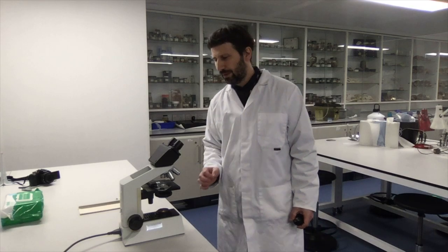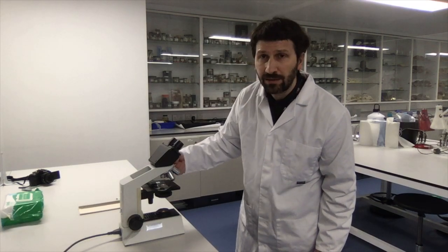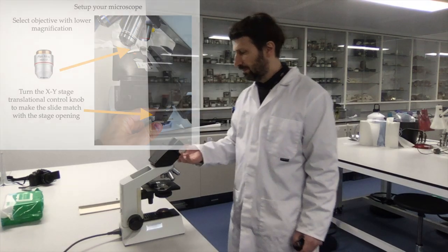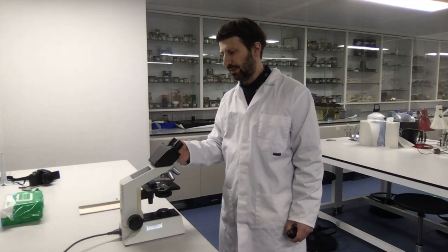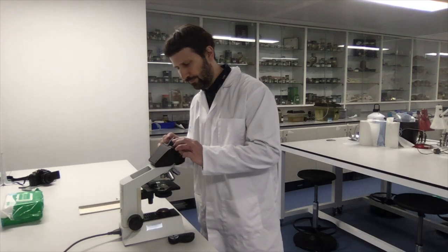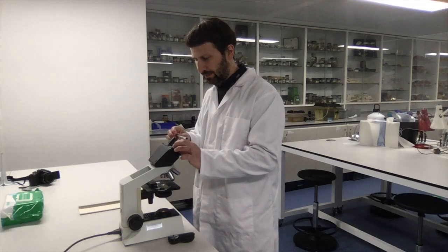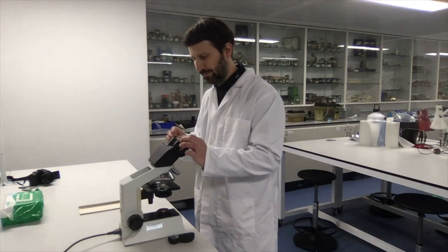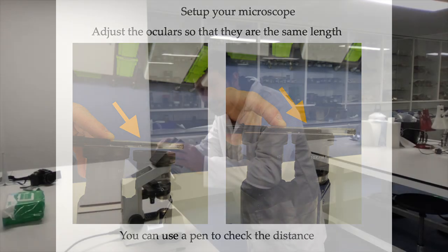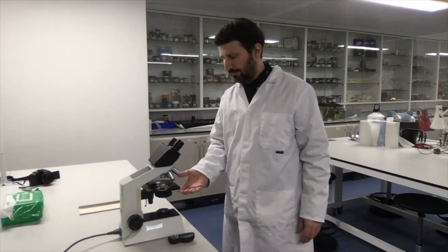So this is the first step. Now you have to set up a few things. It's always good practice to start from the objective with lower magnification — the red one here. If you have another objective set, just go back to the red one. Now you could start looking inside the oculars. You can also start setting them in the right position — the two oculars can be focused independently and can come in or out. The left one in particular can come out. It's good practice to set them to the same length, the same distance, using for instance a pen to help you. Then you adjust the oculars to your eyes so you are able to see the image simultaneously with both eyes.